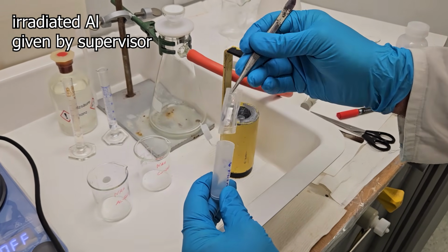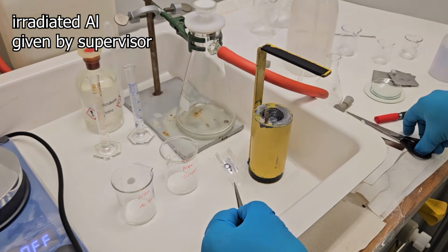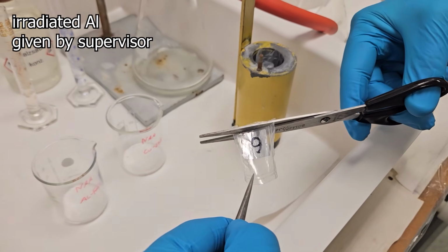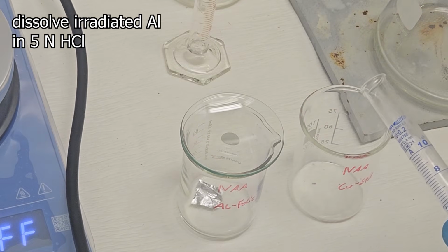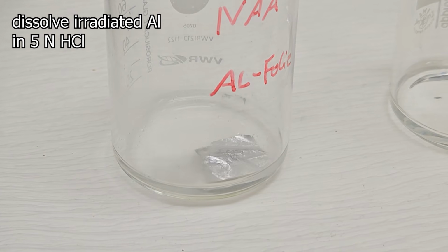Now, after a short decay period, the irradiated aluminium foil is retrieved from the reactor in a lead container. This is done by the assistant supervising the experiment. It is then dissolved in the hydrochloric acid mentioned before. Place a watch glass on top, as we know how aluminium foil reacts with acids. And on top of that, it's now radioactive.